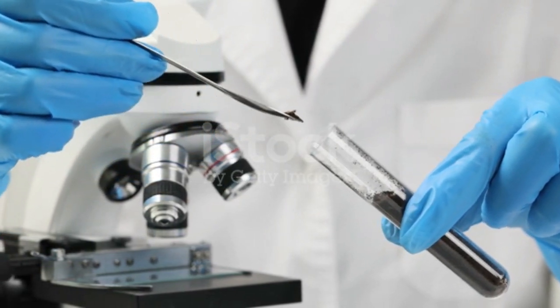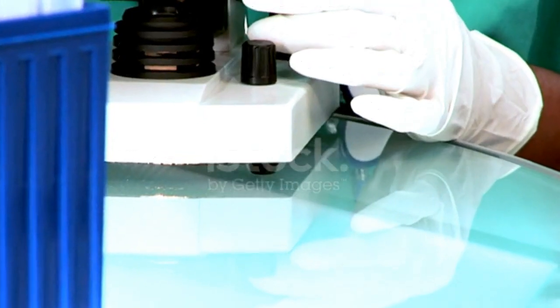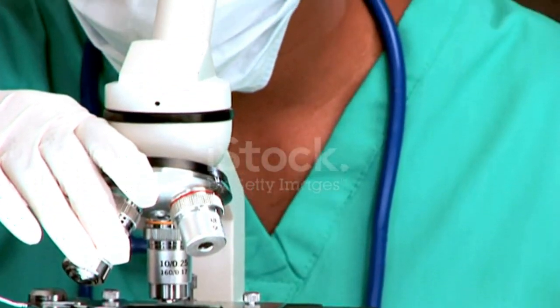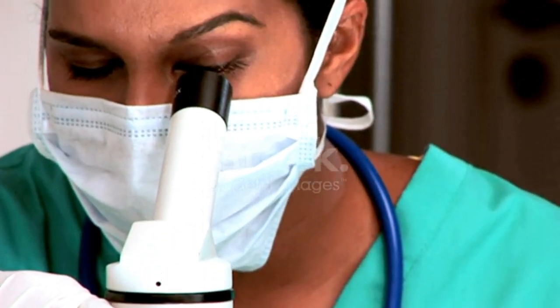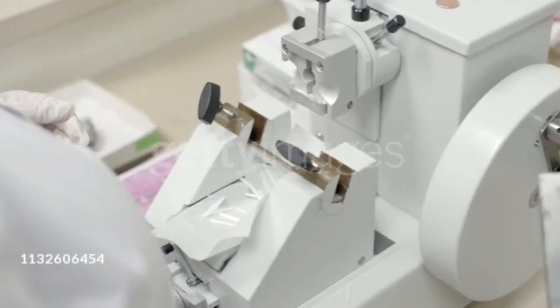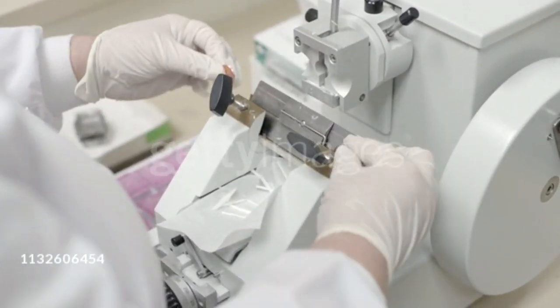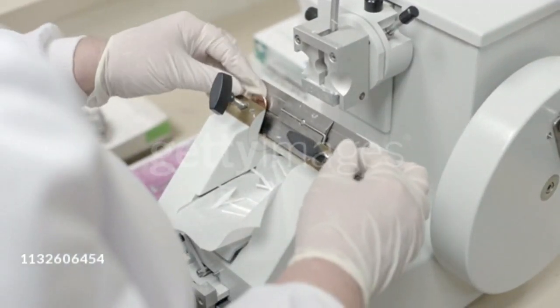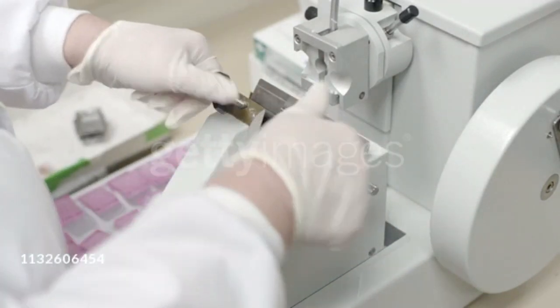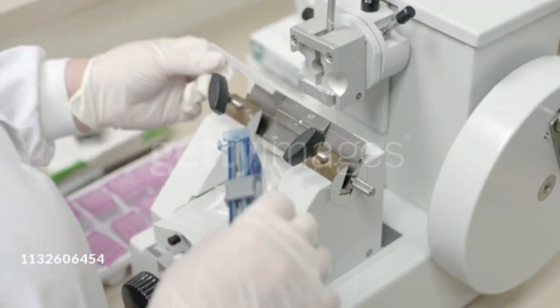5. Transmission Electron Microscopy. Exploring the principles of transmission electron microscopy, where electrons pass through the specimen to create detailed internal images. TEM has been instrumental in studying the ultrastructure of cells and materials at the atomic level.